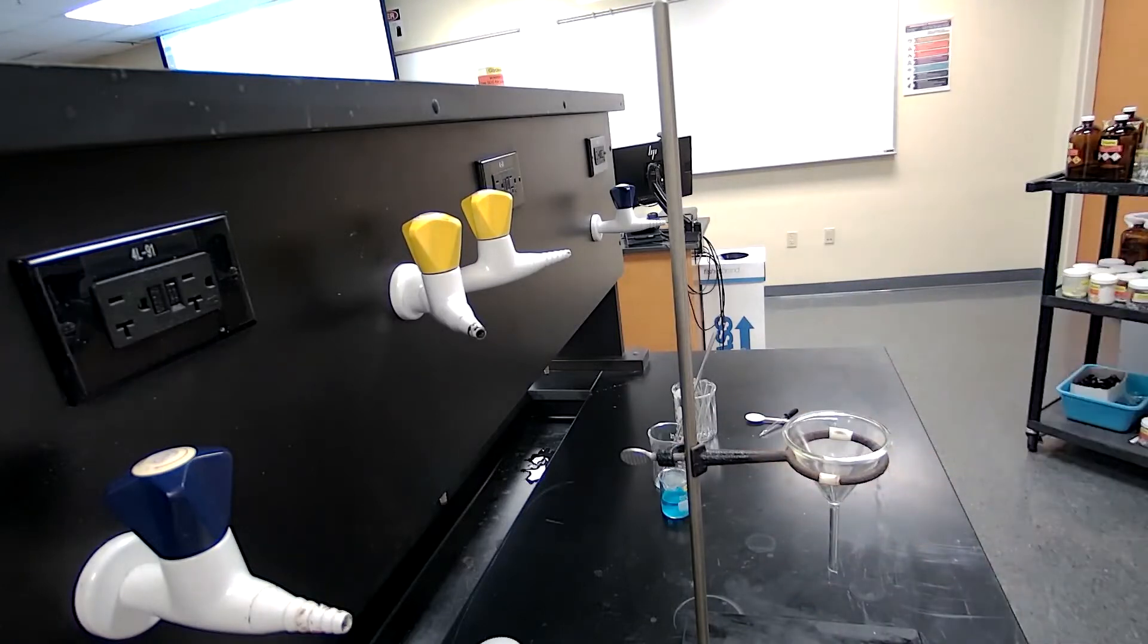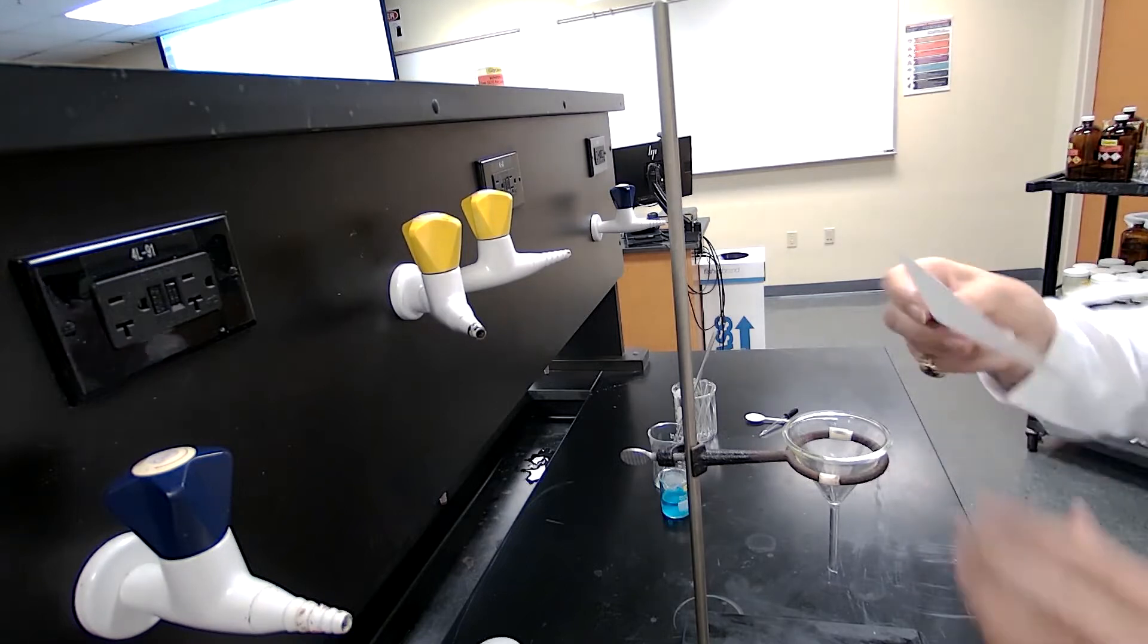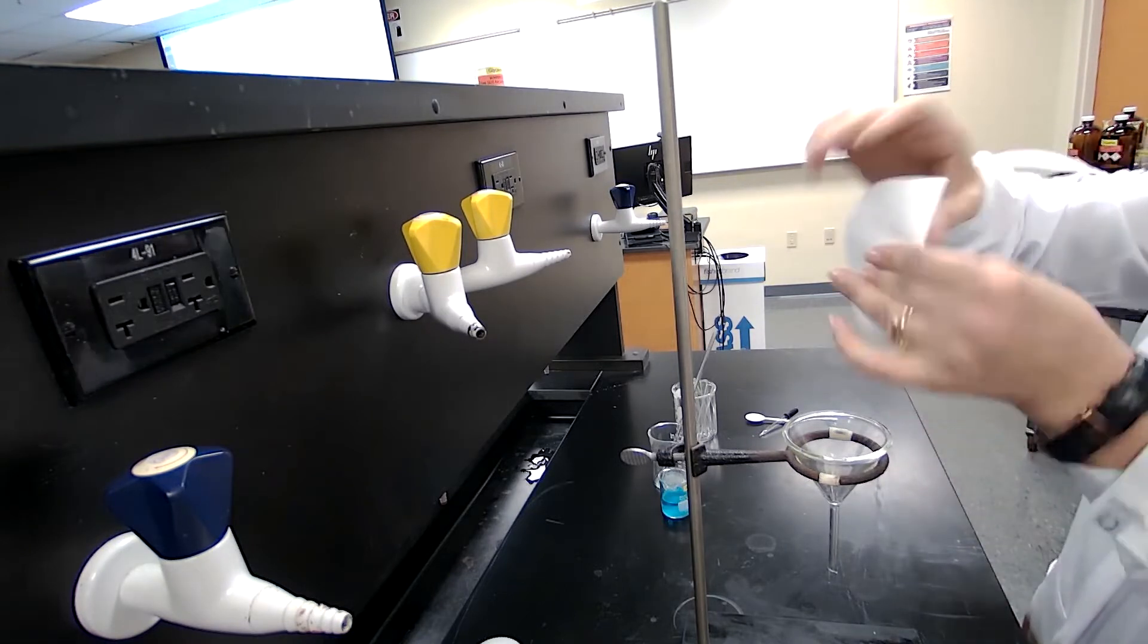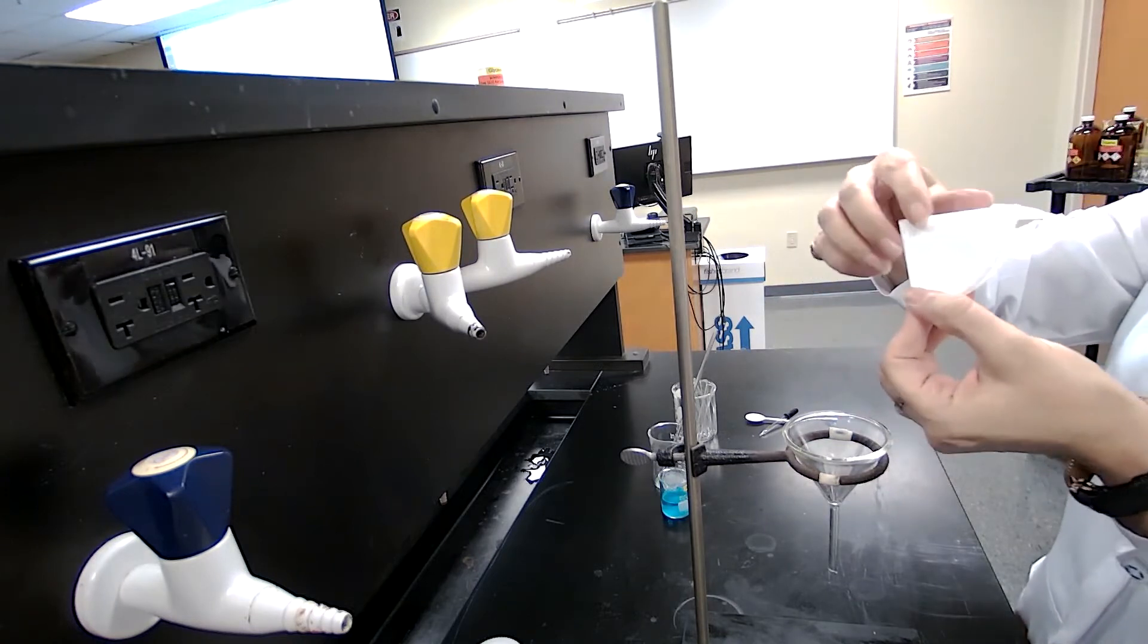Now, to prepare the filter paper, I take one large filter paper, fold it in half, then fold it in half again for a second time.